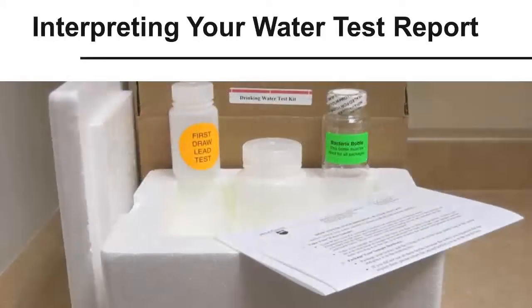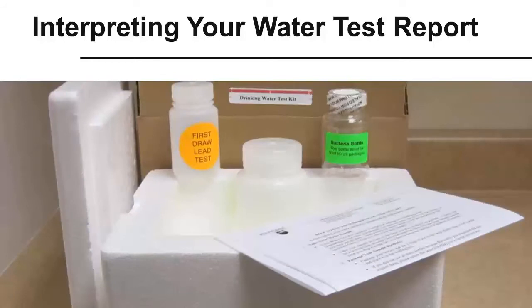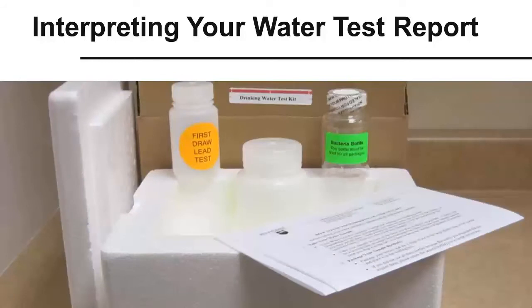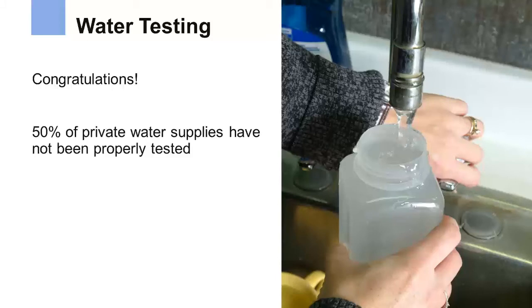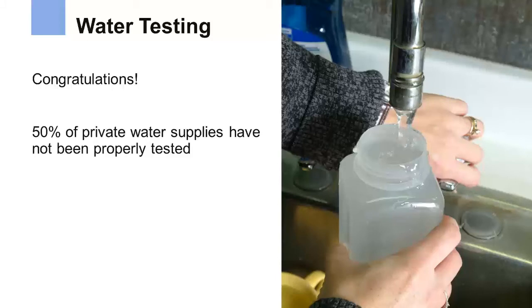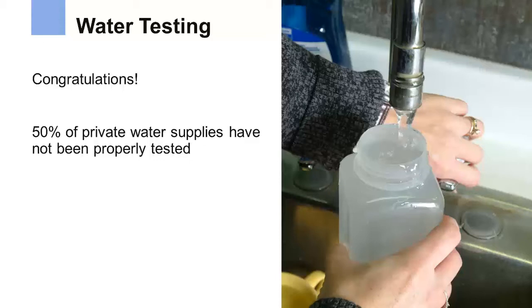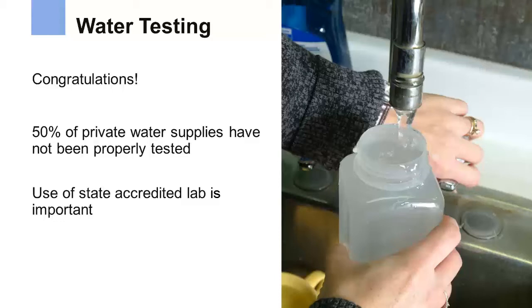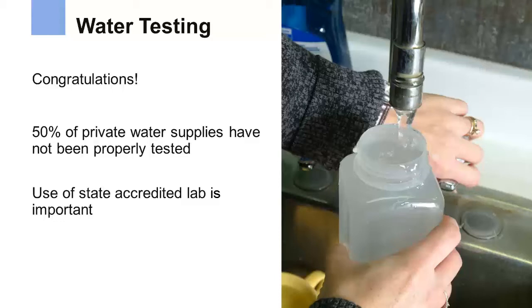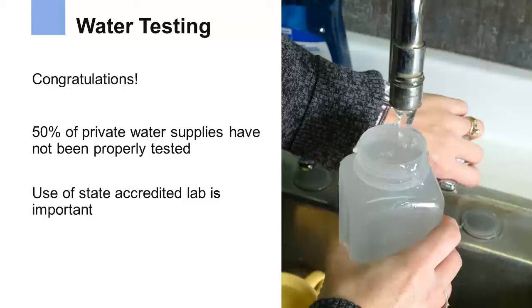Hi, my name is Brian Swistock. I'd like to take a few minutes to go over what's in each Penn State Water Test Report to help you interpret what your results mean. First, congratulations on getting your water tested. Our surveys have shown that only about half of the private water supplies in Pennsylvania have been properly tested by a state-accredited lab. Use of state-accredited labs like the Penn State Agricultural Analytical Services Lab is vital to ensure that you get accurate and unbiased results.